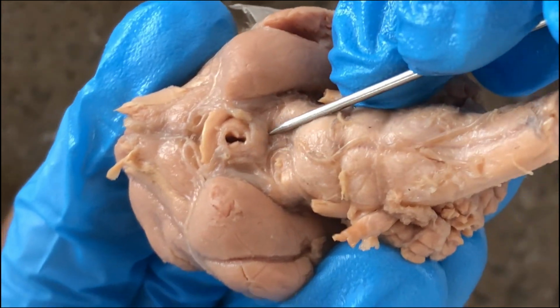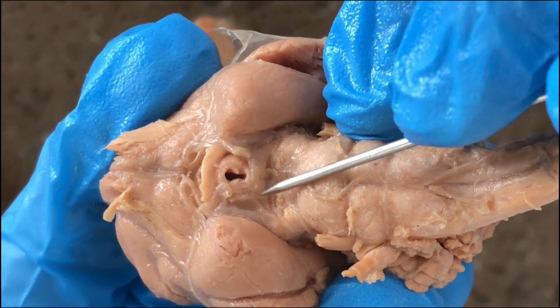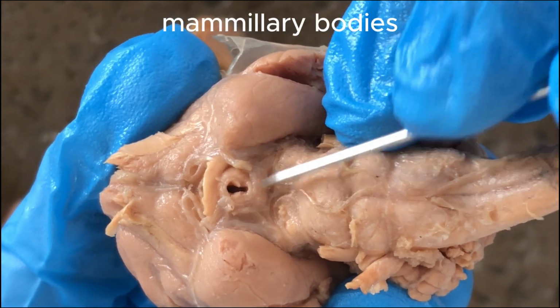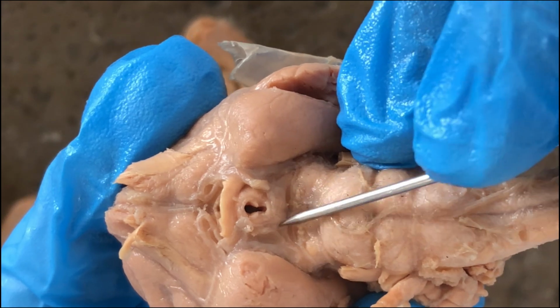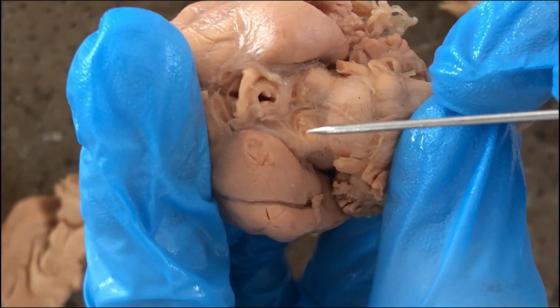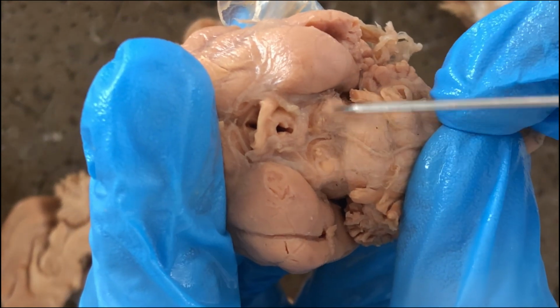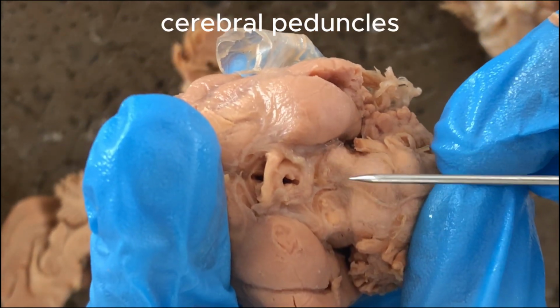And then if you move more posteriorly, there's another bulge corresponding to the mammillary bodies. Mammillary bodies posterior to the tuber cinereum. And then these two here are the cerebral peduncles, already part of the midbrain, not part of the hypothalamus.